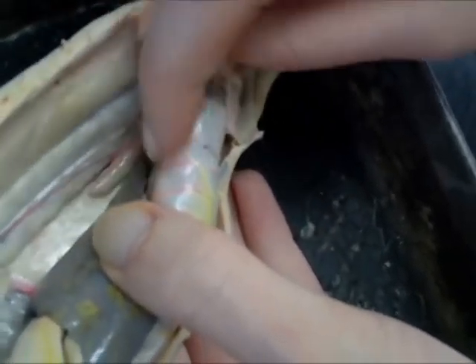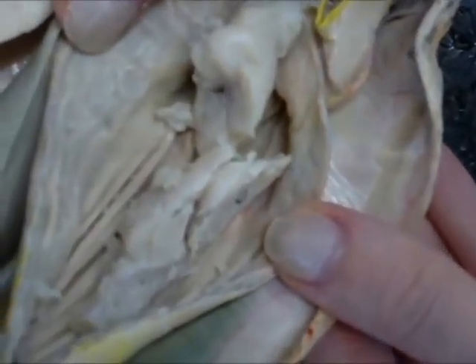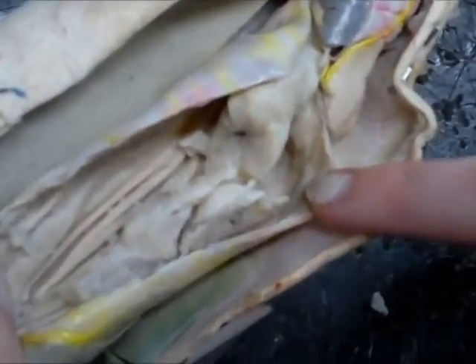Did we get the digitiform gland? Mm-hmm. Here's the contents of the stomach — the upper and lower stomach. You can see where it goes from the esophagus, with these bumps, to the folds, which is the actual stomach.